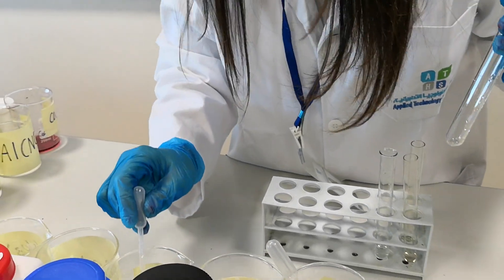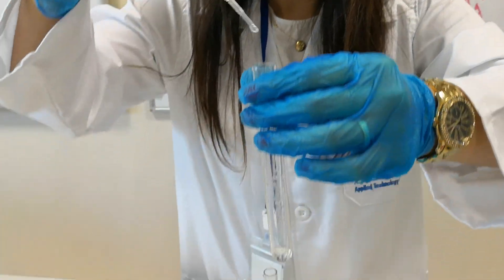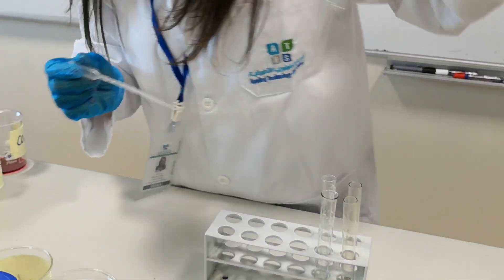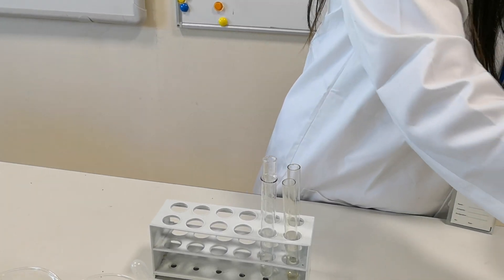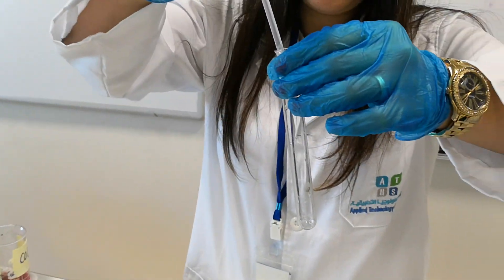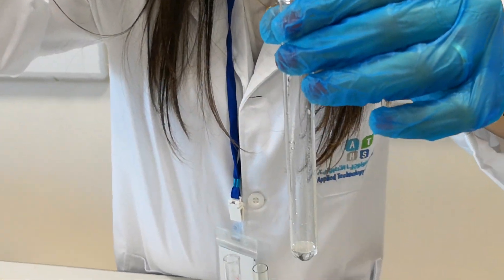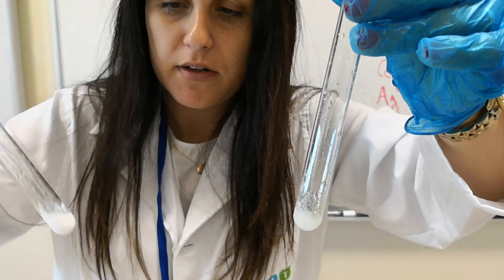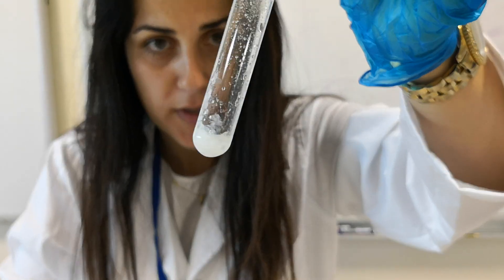Let's try calcium. This is calcium with the hydroxide — a white precipitate forms, so we will do another test to identify the calcium. Now let's take the magnesium. This is magnesium with the hydroxide. Comparing the two: the calcium precipitate is brighter, while the magnesium makes a gelatinous white precipitate.